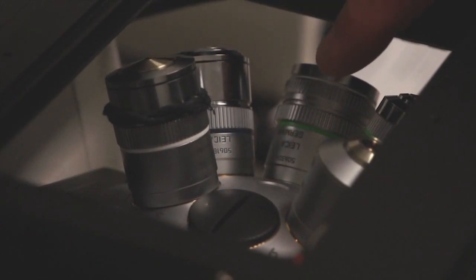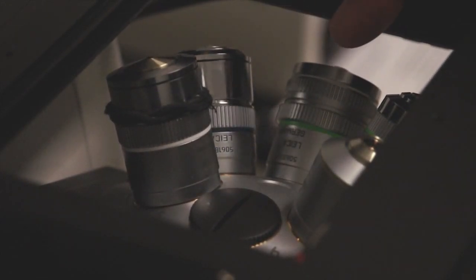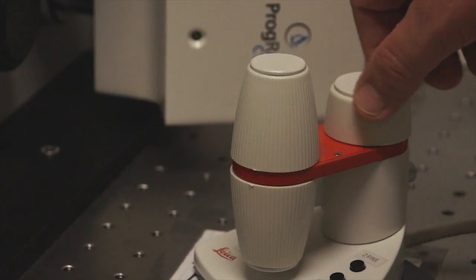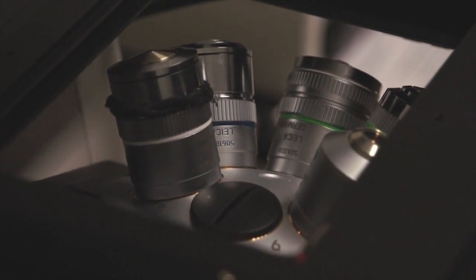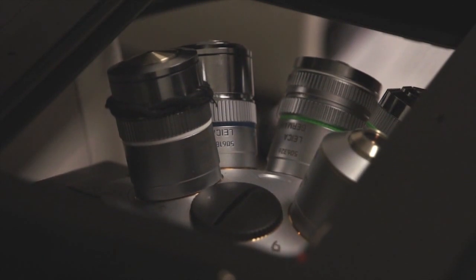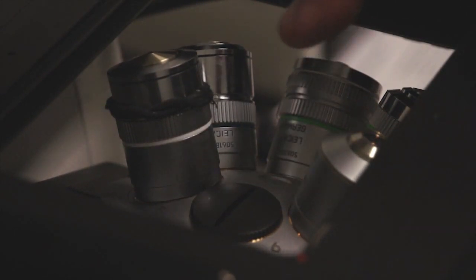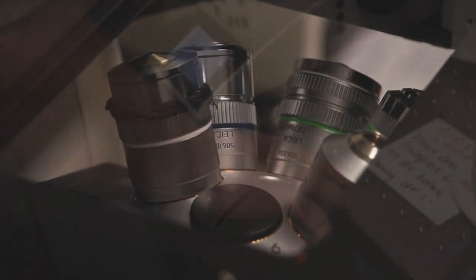Pay close attention to the nose piece as I'm going to actuate the focus drive on the salt and pepper shaker. And you can see as I manipulate the focus drive, the nose piece goes up and down. This is very important to understand because you can very easily and quickly drive the nose piece into your specimen that's held in place above the nose piece. So take particular care when you're using the salt and pepper shaker to get the right focus.